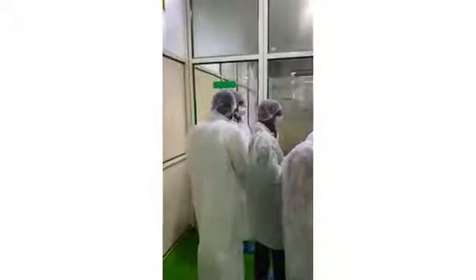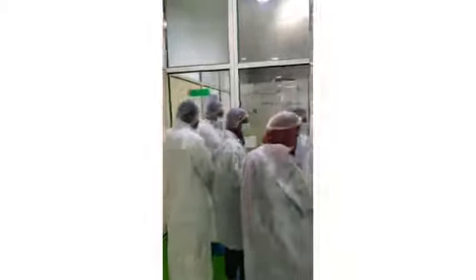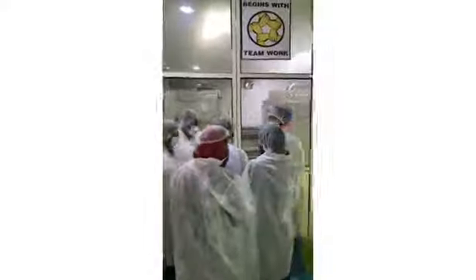Dryers. Here we do drying of the raw material which is being used for the products. So we remove the moisture and micro load. That will ensure quality. These are the dryers that will go for the beverage section.